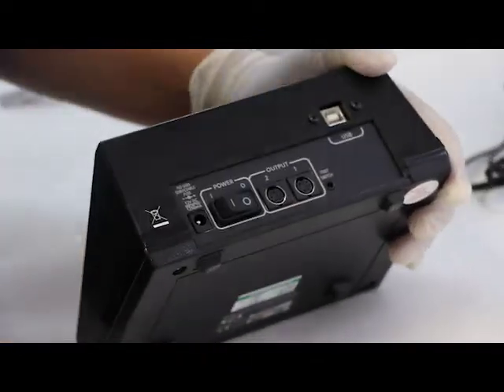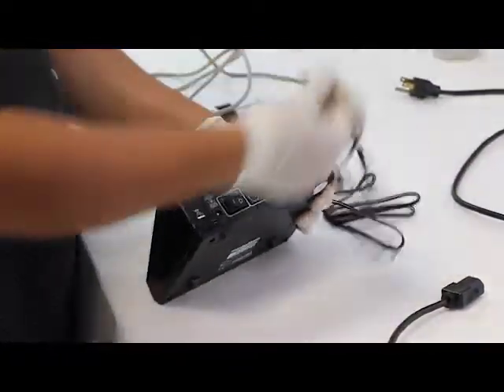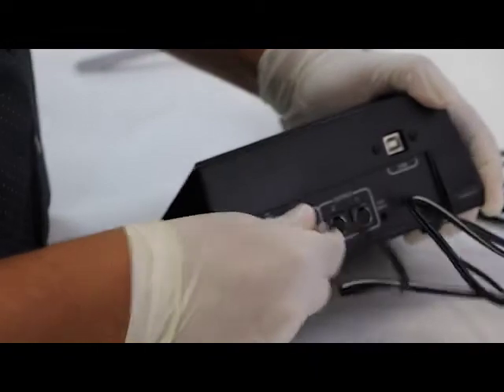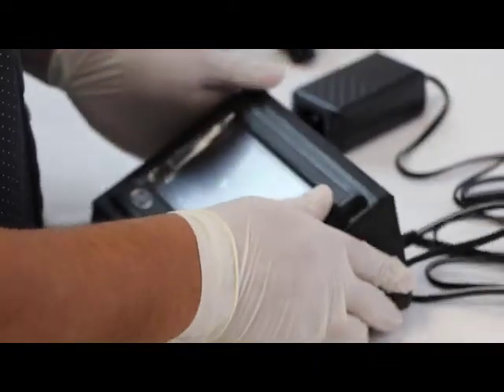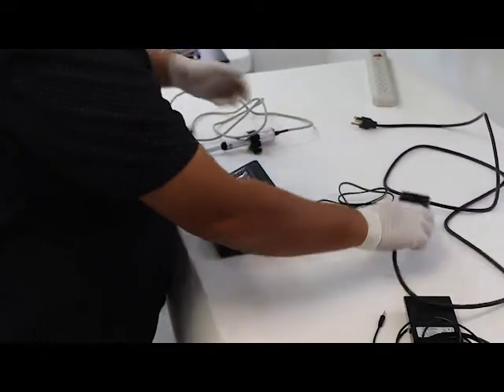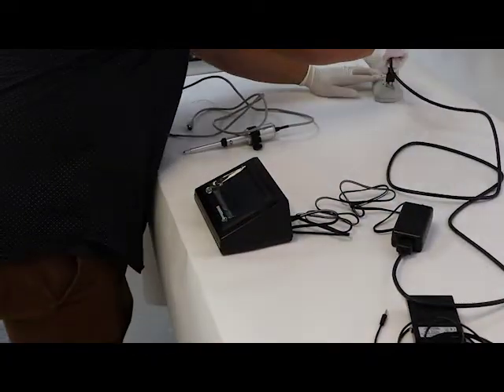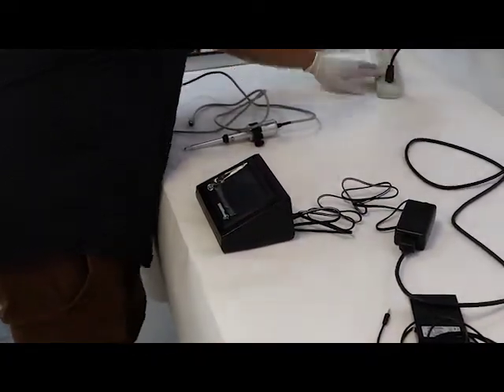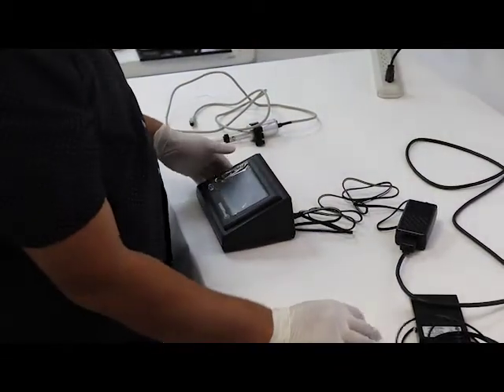The first thing we should plug in is the power supply that's included with the system. Plug in the power supply to a power cord. And of course depending on the country you're coming from you get the correct power cord.